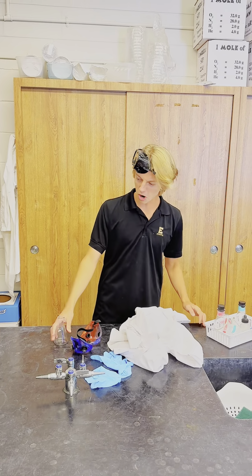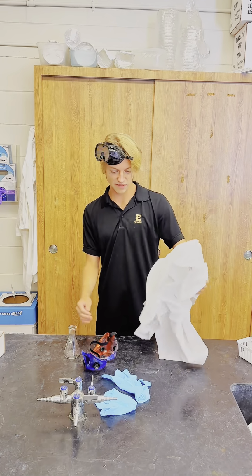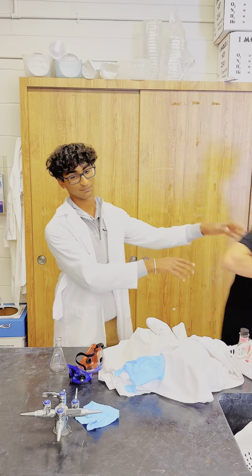Yo, if only someone could help me. A bunch of acids and stuff. A lot of safety gear to wear, but don't know how to put it on. I got you, buddy.